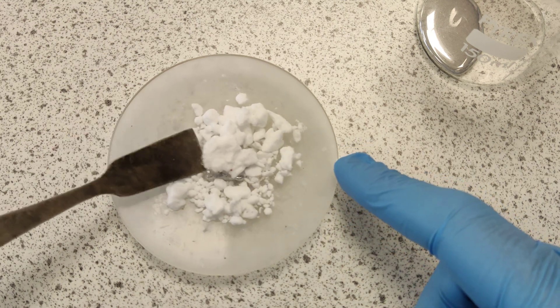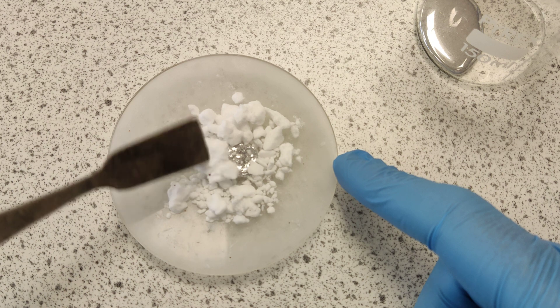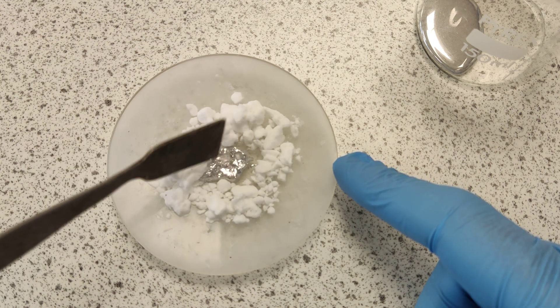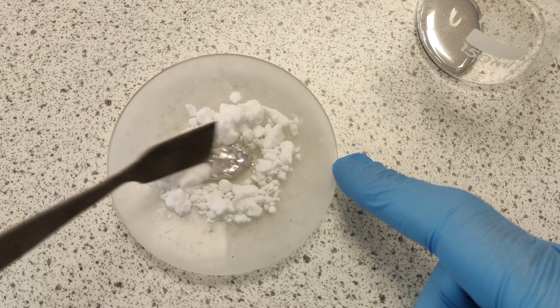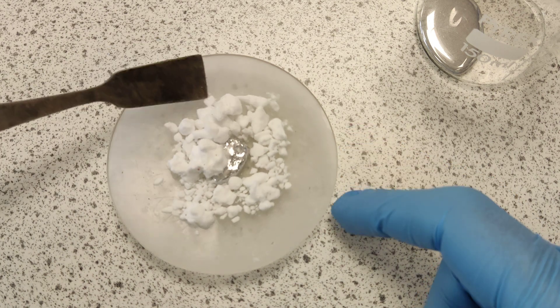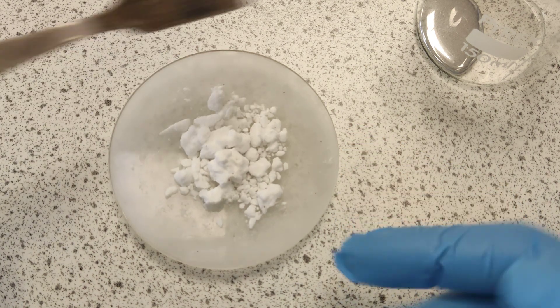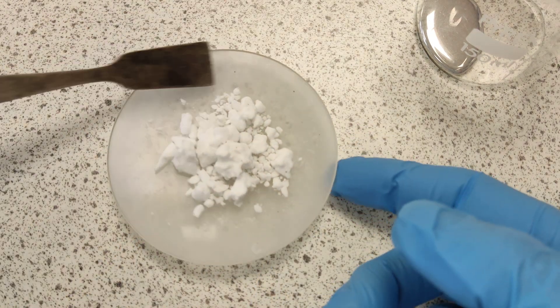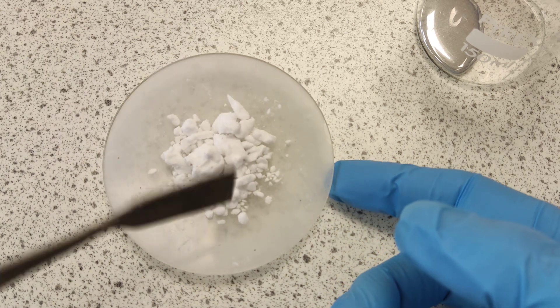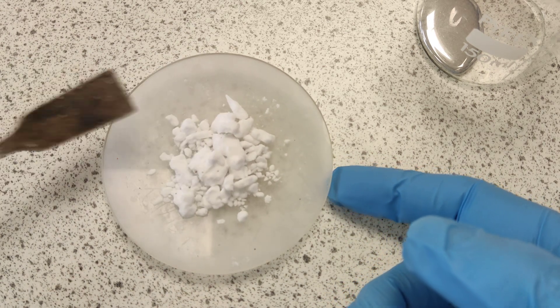Remember, we're at room temperature. So what I'm doing is freezing mercury, which is a liquid at room temperature. You can see I'm wearing gloves — be very careful, I've got my eye protection on. But it's actually a very safe experiment with little to go wrong if you're careful.